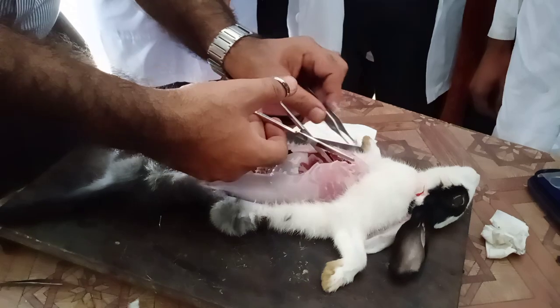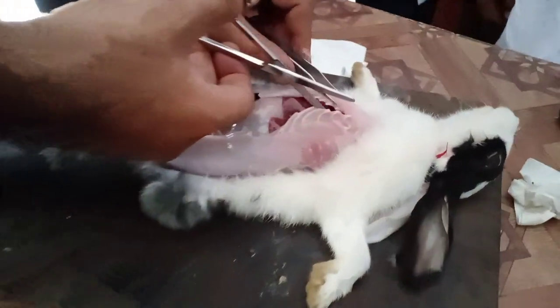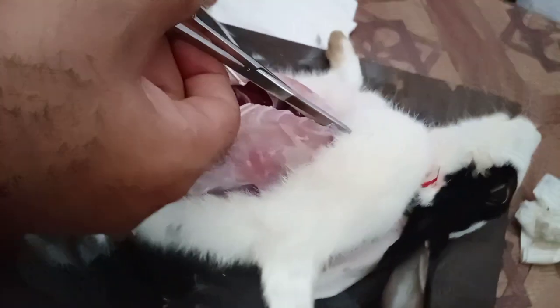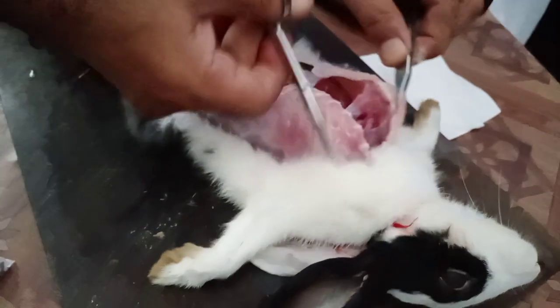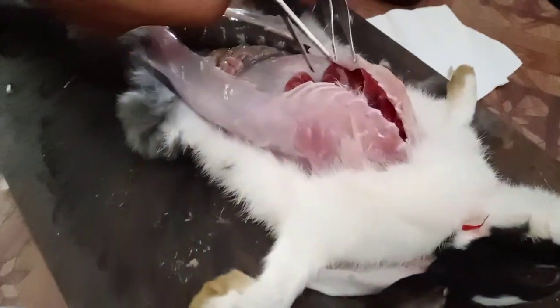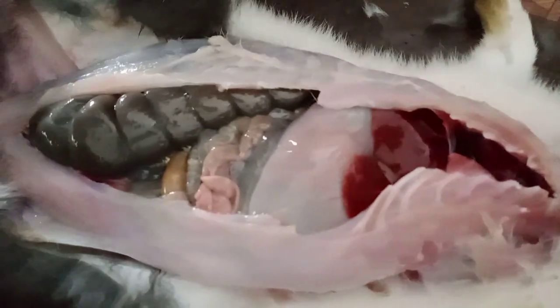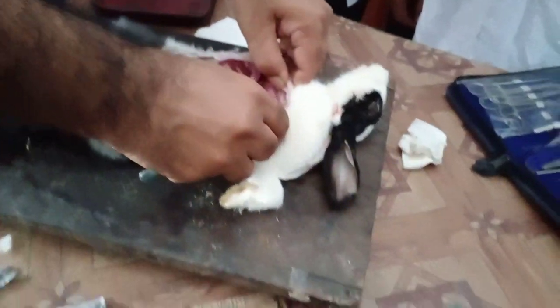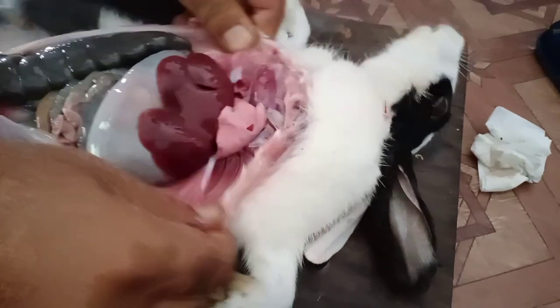This is the chest region — these are the ribs, you can see. And you have to expose it like this.